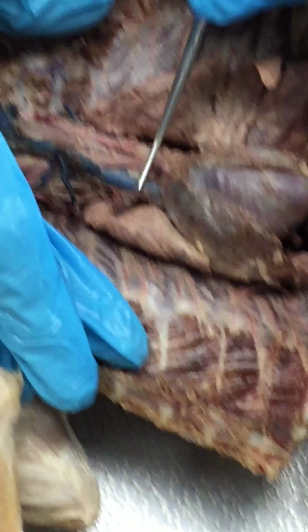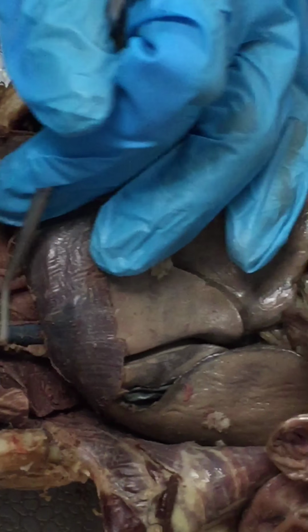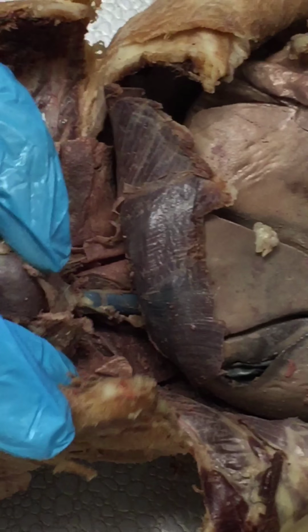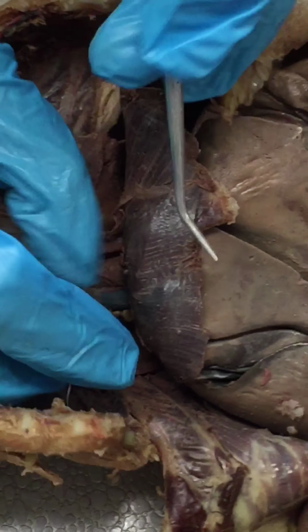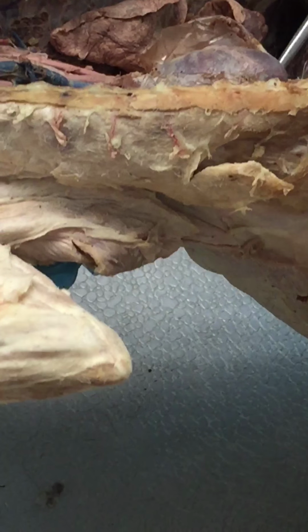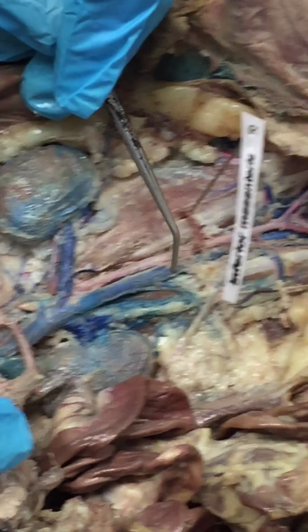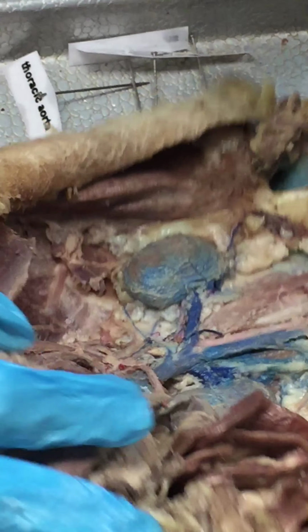Okay, so superior vena cava right here. Inferior vena cava would be this big blue one right there. That, again, beneath the heart, therefore it's the inferior. You can do that one again for me? Yeah, absolutely. So, superior vena cava is above the heart. Inferior vena cava, maybe it'd be easier for you to see if I pick it up. Right there, going beneath the heart. Okay? No problem. And that will go the whole way, and you can still see it right down here. Keeps going down here, inferior vena cava the whole way down. Okay? Until you get to your iliacs, just like the abdominal aorta.